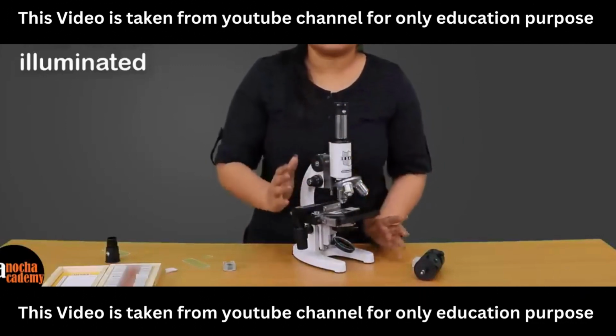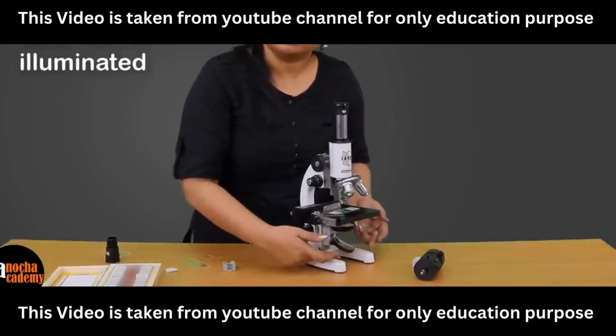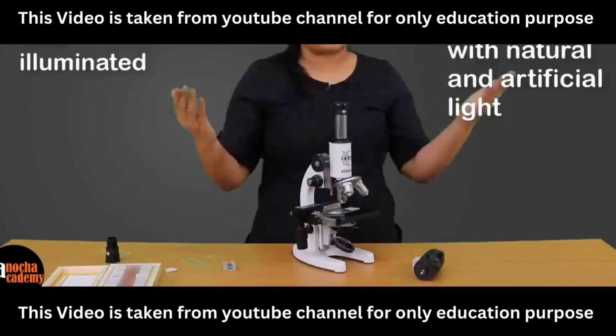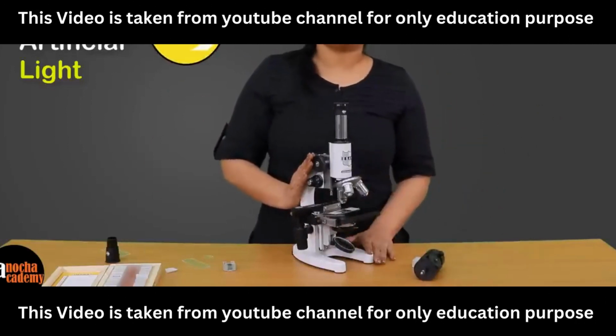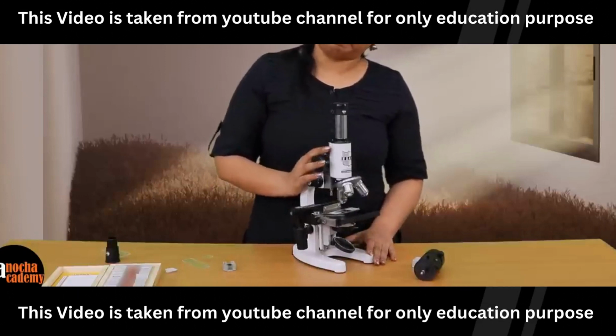It is not dark, it is not black, it is illuminated. The mirror will be able to collect light from natural or artificial sources. You can do this in front of an artificial light, or in front of a window through which sunlight is coming in, right?